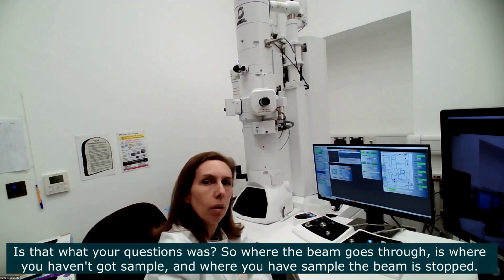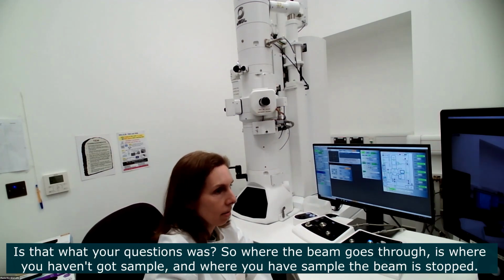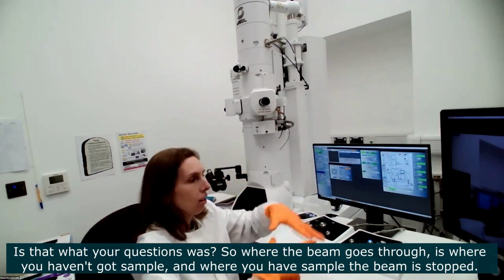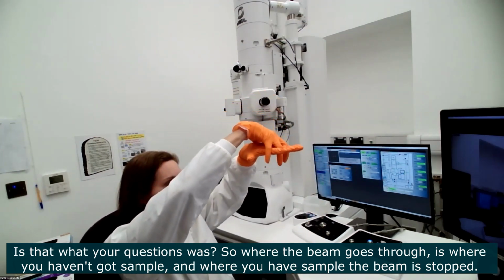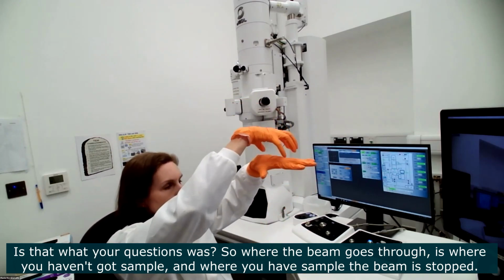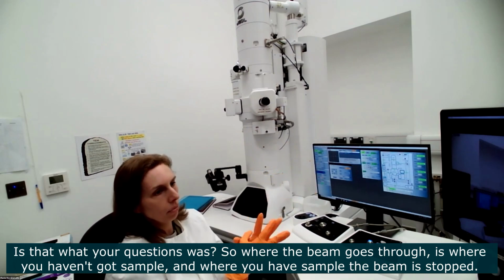Is that what your question is? What affects the image projection? So where the beam is going through is where you haven't got sample, and where the beam is blocked is where you have all the sample details.